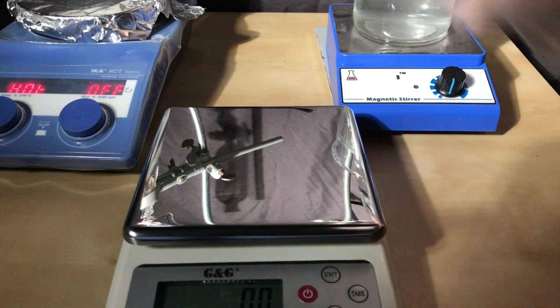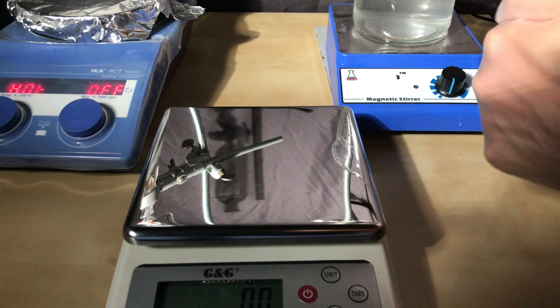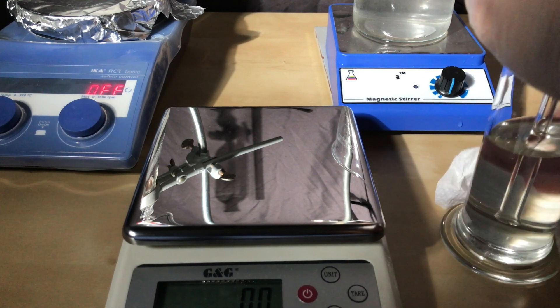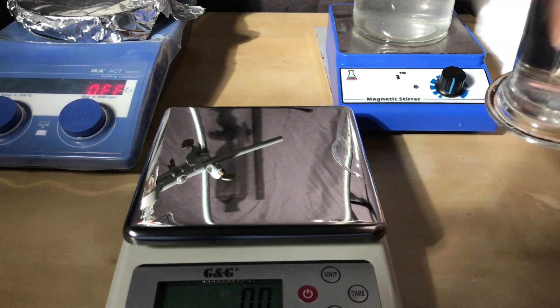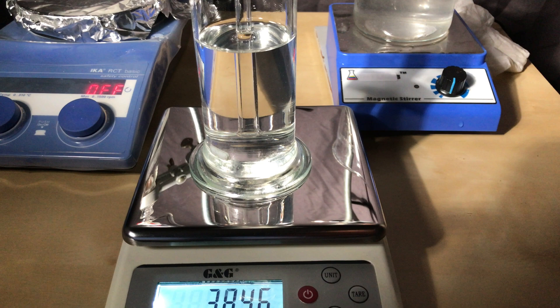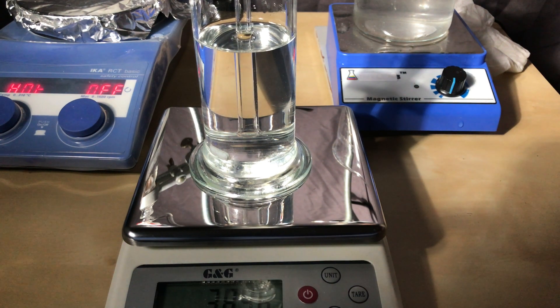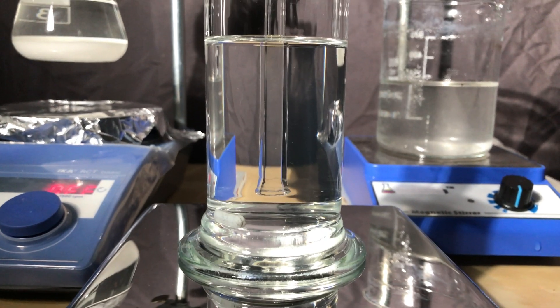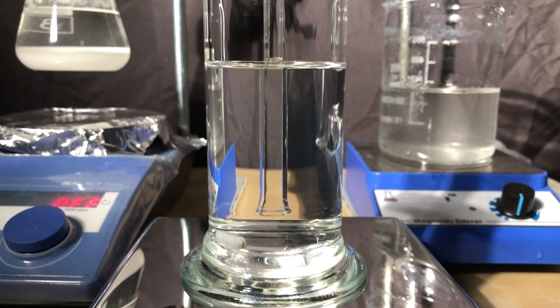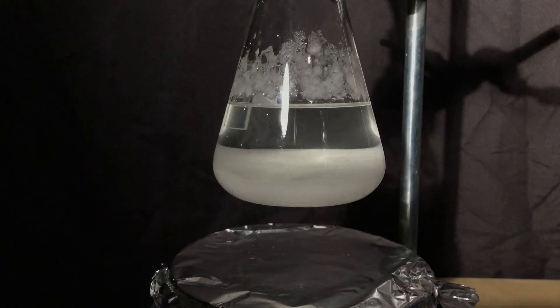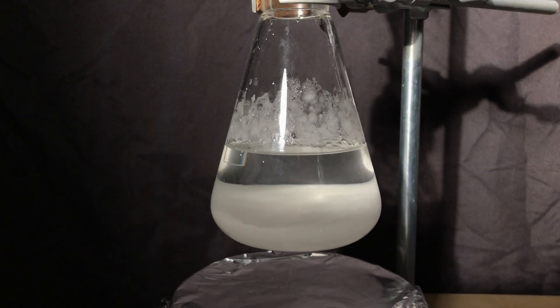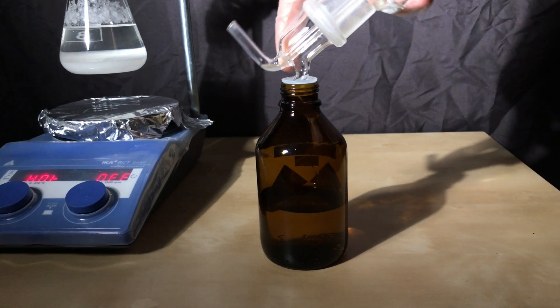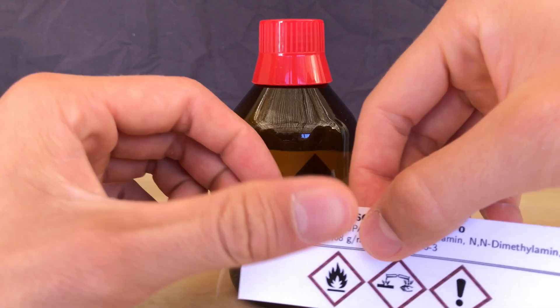Dimethylamine is still being produced and you shouldn't inhale it, so put on a gas mask. We're still working in a very well ventilated area. After drying the gas washing bottle it was weighed again. In the end we ended up with 42.2 grams of dimethylamine which represents a yield of 93.6%. I accidentally added more water than planned but I took it into calculation. Our solution of dimethylamine has a concentration of 37.8%. It was quickly transferred to a storage bottle and the bottle was labeled appropriately.